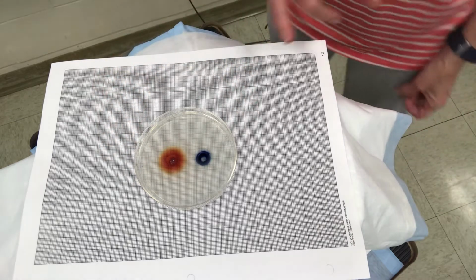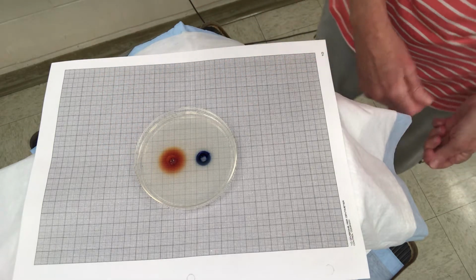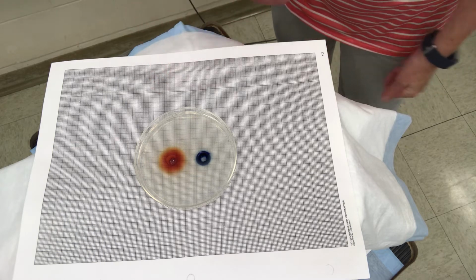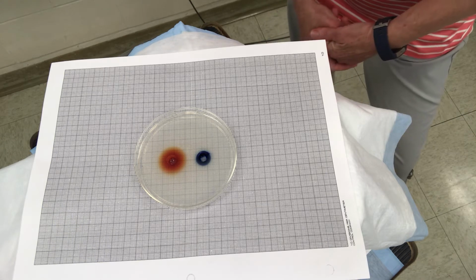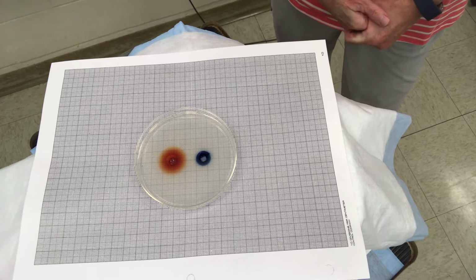And we have taken 2 little holes, and we have put the blue dye, which is methylene blue, which has a molecular weight of about 320, in one well. And we have put potassium permanganate, the golden one, in the other well, and that has a molecular weight of about 156. So potassium permanganate is a much smaller molecule than the methylene blue.